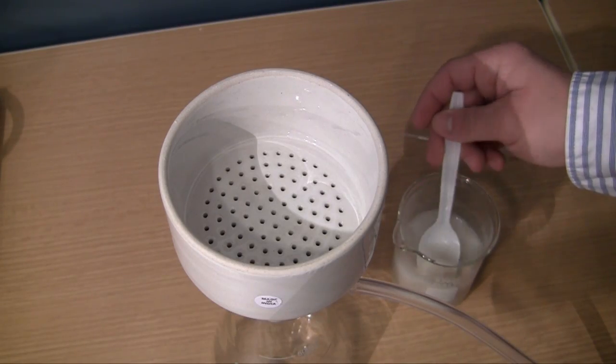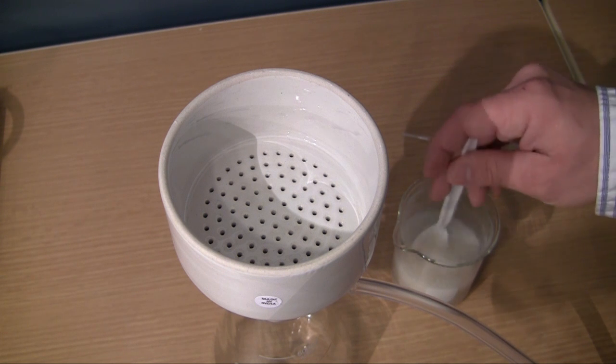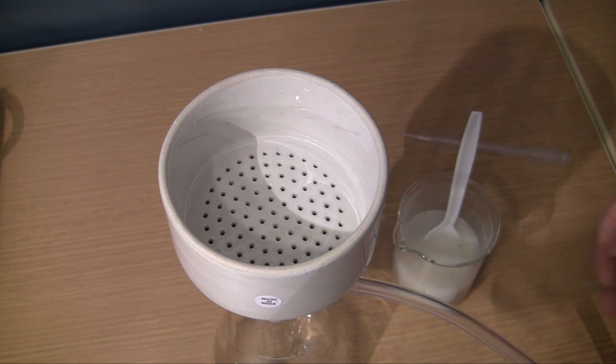Now this is my mixture right here. It's just a really simple mixture I made for demonstration. Just some sand and some water. So basically what we're going to do is we're going to filter the sand from the water.